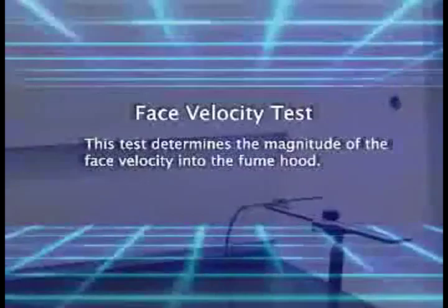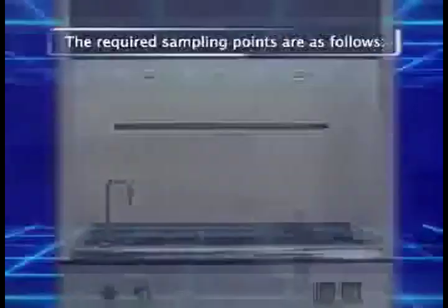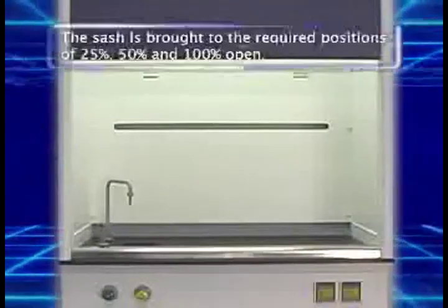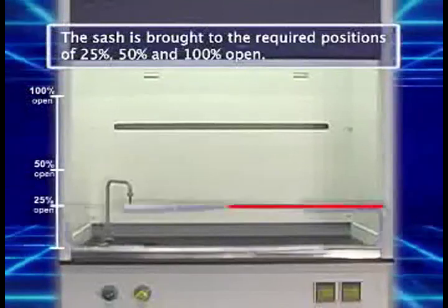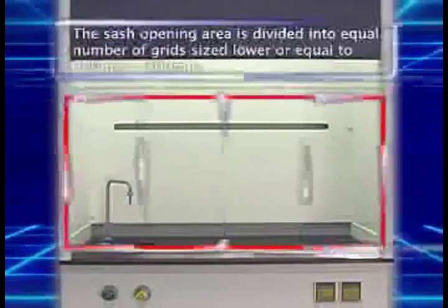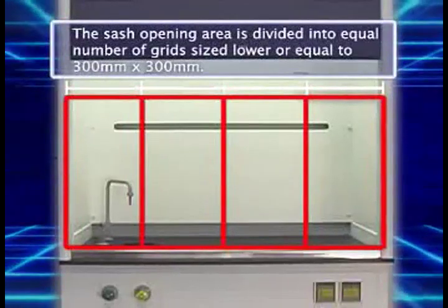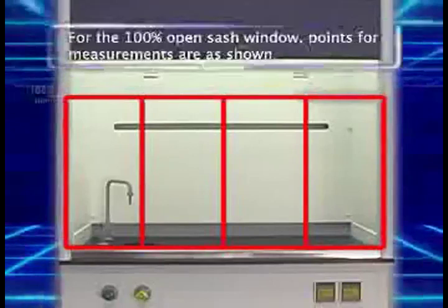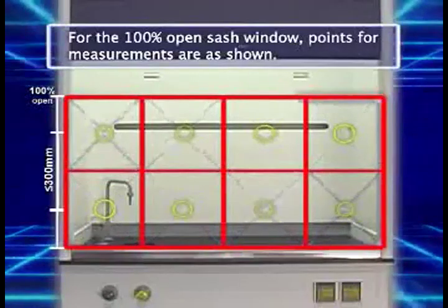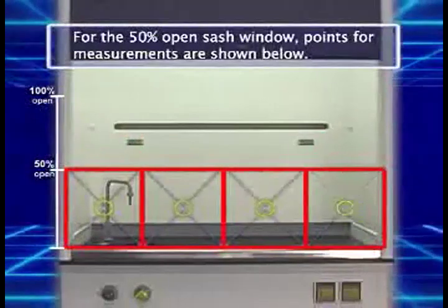The face velocity test determines the level of face velocity at a number of sampling points across the front of the fume hood. The test is carried out with the sash open at 25%, 50%, and 100%. At each height, the open area is divided into an equal number of grids, each no larger than 300 by 300 millimeters. Measurements are taken in each grid, then the sash height is adjusted and the test is repeated.